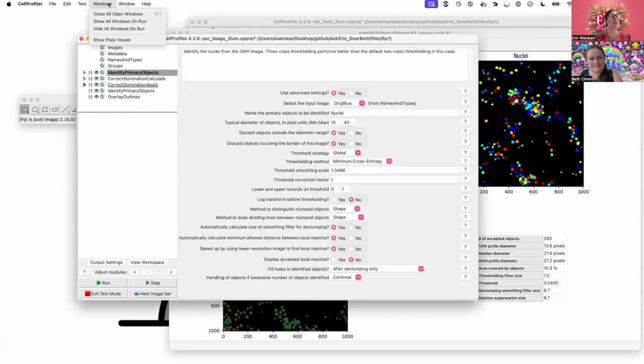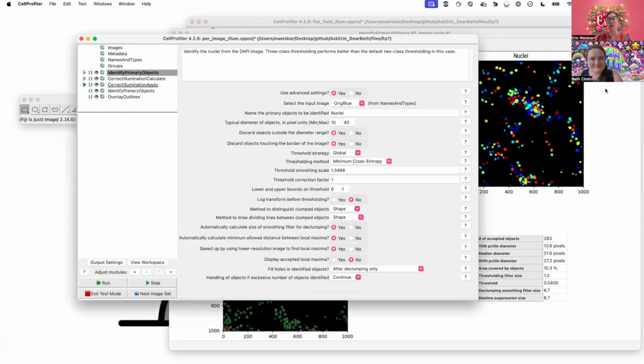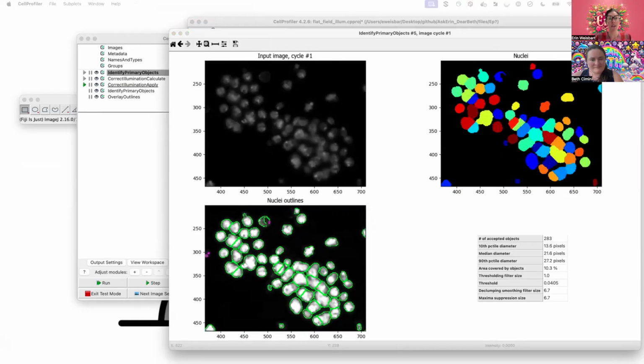So if we go to help, show welcome screen and click on try example, it will load these images and an example pipeline that has these settings for identifying these objects in the nuclei. But if I notice, so I'm going to focus in on this region, and I'm scaling the contrast a bit.